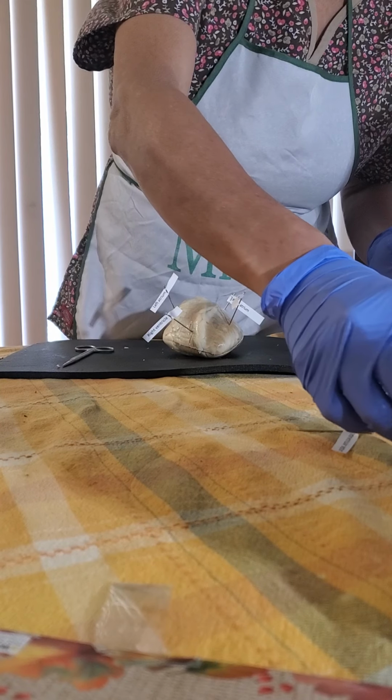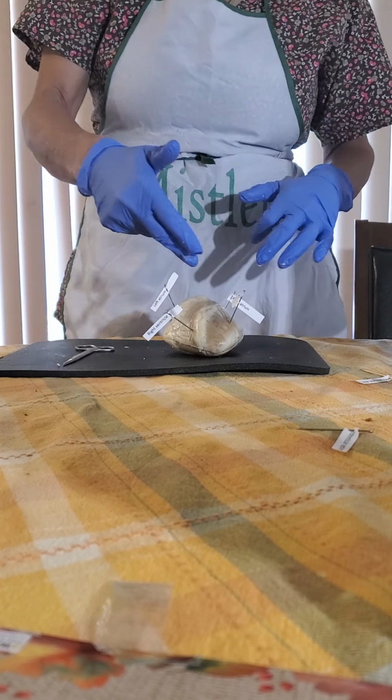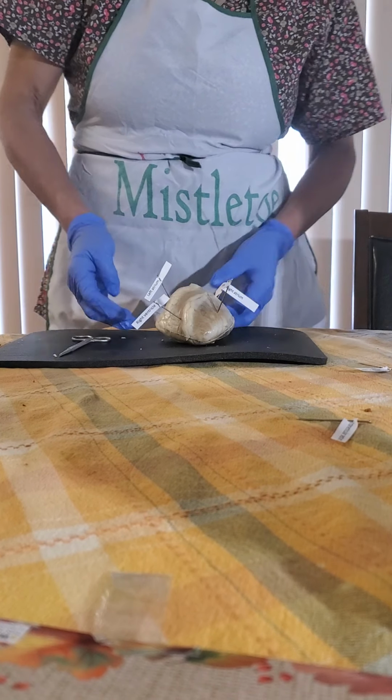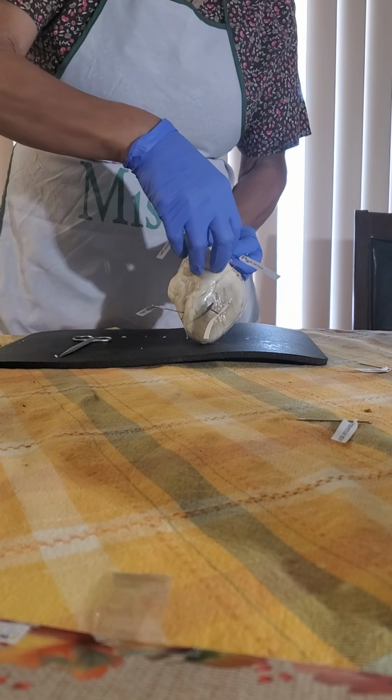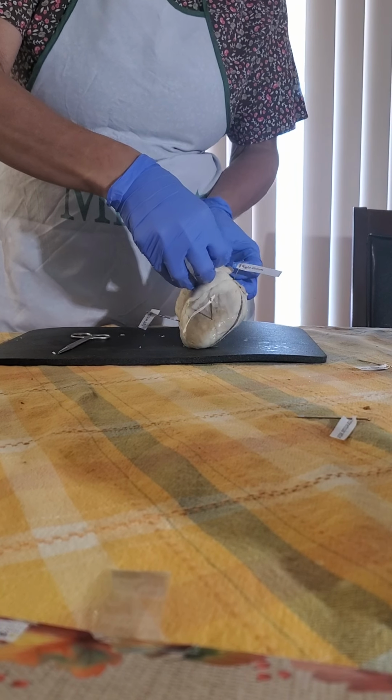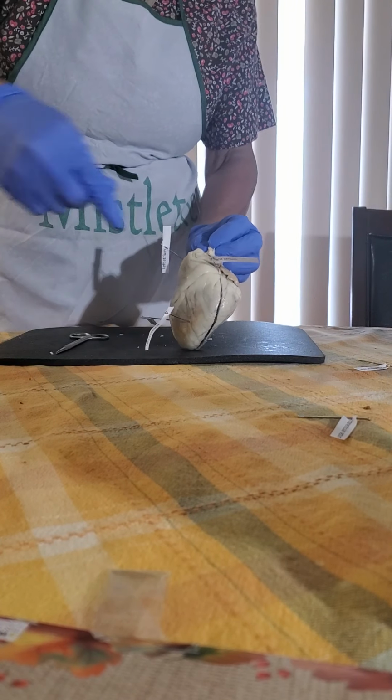Then the other major landmark in the anterior surface view is the pulmonary artery, which is the most anterior blood vessel that can be seen.